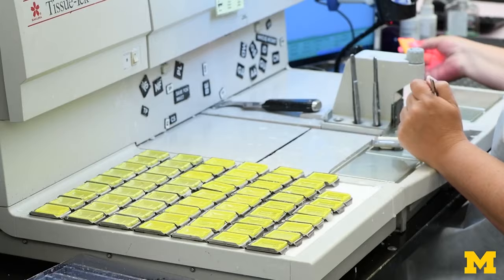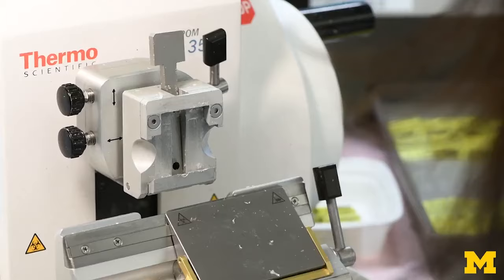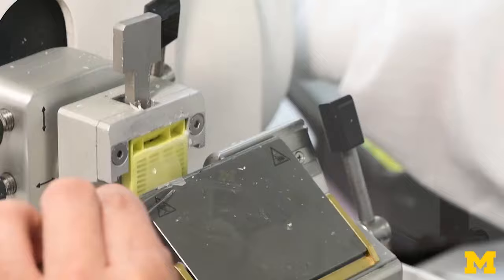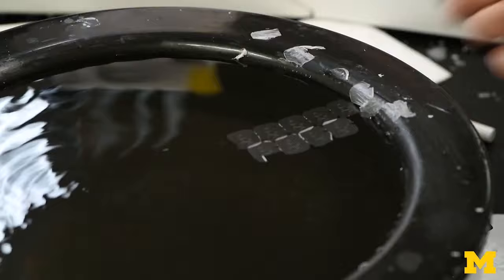When the wax has completely cooled, the hardened paraffin blocks will be cut. The cooled blocks are made even colder by laying them out on a solid tray of ice, ensuring that the wax is hard enough to slice extremely thin. The chilled paraffin blocks are then placed into a microtome, or a blade mounted onto a rotating handle. Each slice made by the microtome is only 4 microns thick — far thinner than a human hair. These are carefully picked off of the microtome and laid into a water bath.